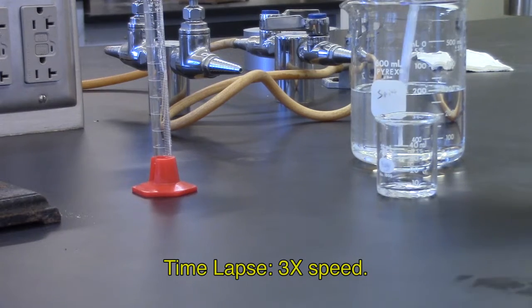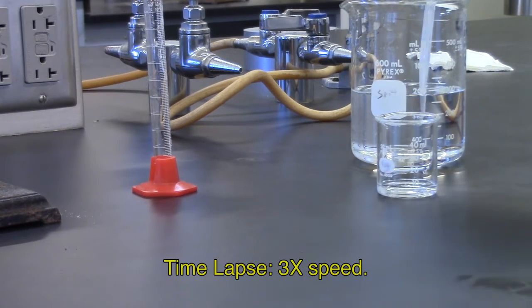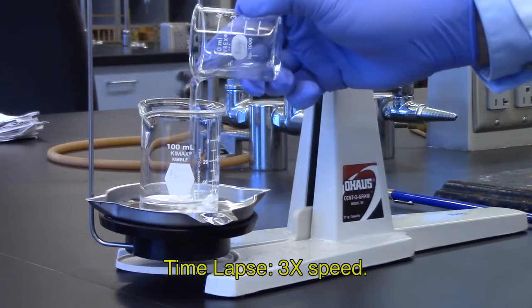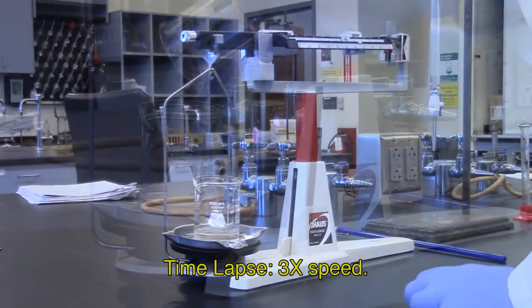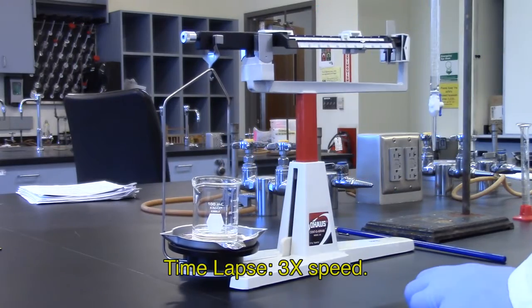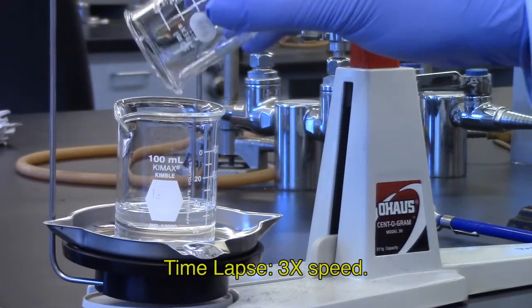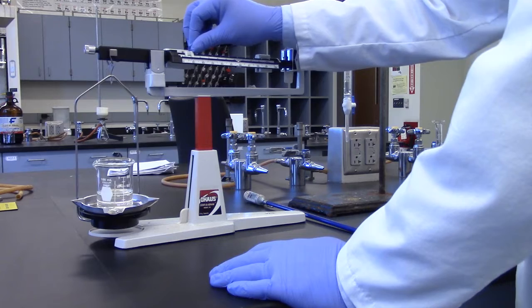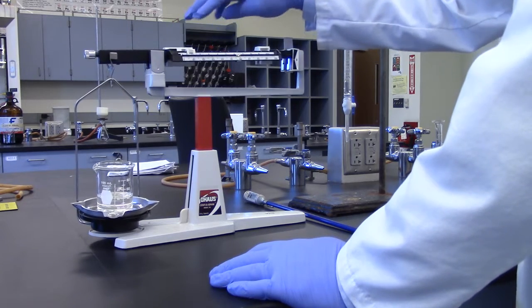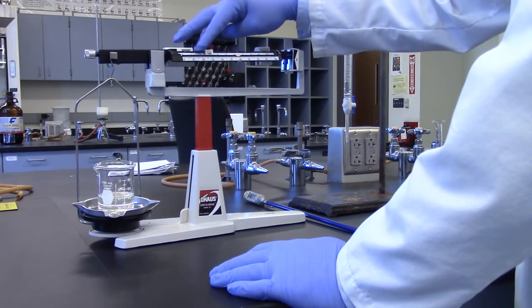Repeat four more times, measuring out 10 milliliters of water with the 50 mL beaker and transfer to the 100 milliliter beaker. You will add 10 milliliters each time instead of emptying and drying the 100 milliliter beaker. Re-weigh after each 10 milliliter aliquot addition.